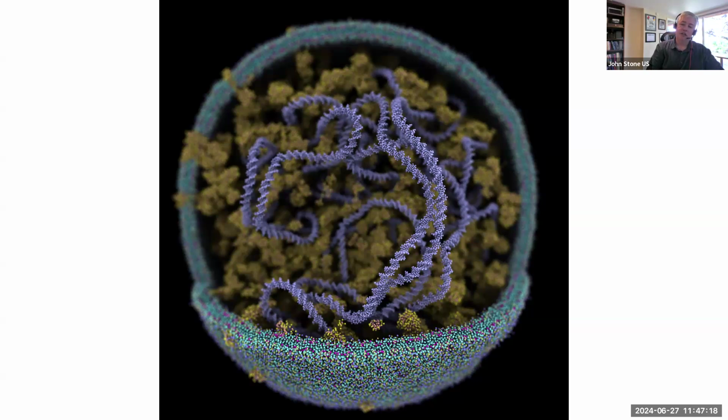But when you're going for 1 billion atoms, especially if you're doing a trajectory, maybe we care more about the memory than the other things. So there are some things you can do to reduce how much memory VMD uses by doing a simple recompile. But aside from that, 1 billion atoms is well within the stock version.